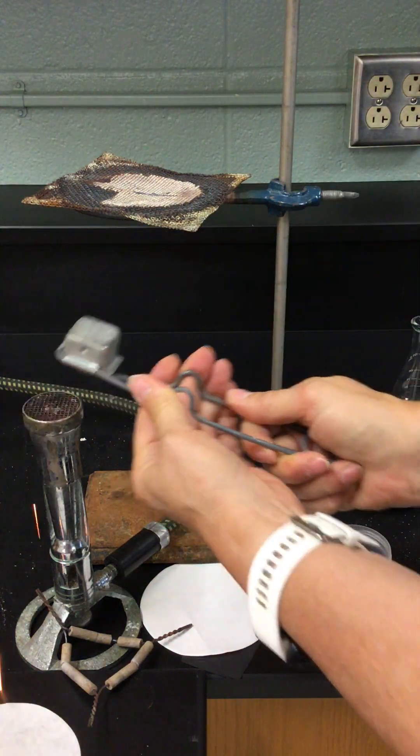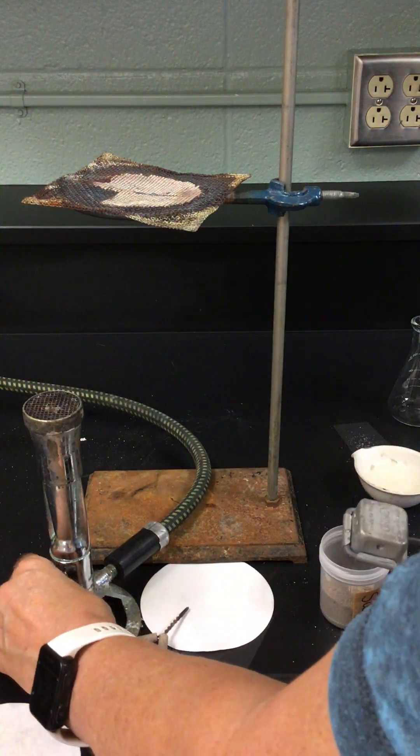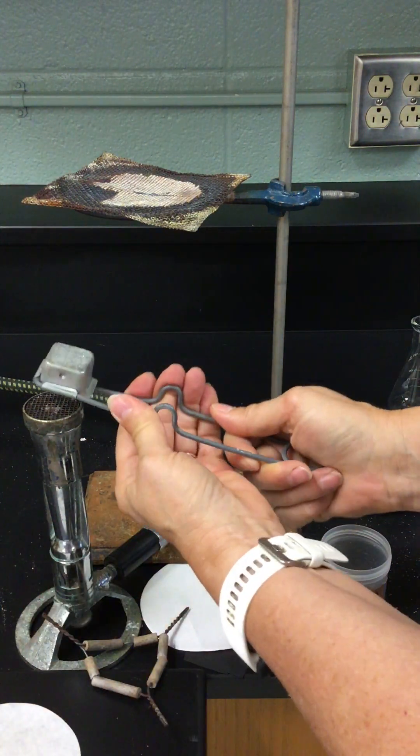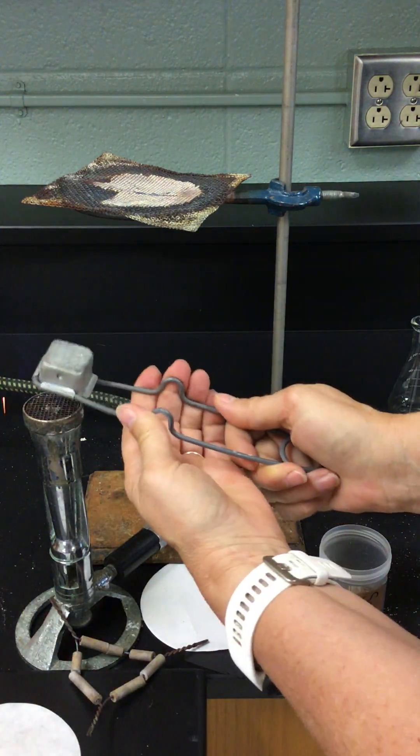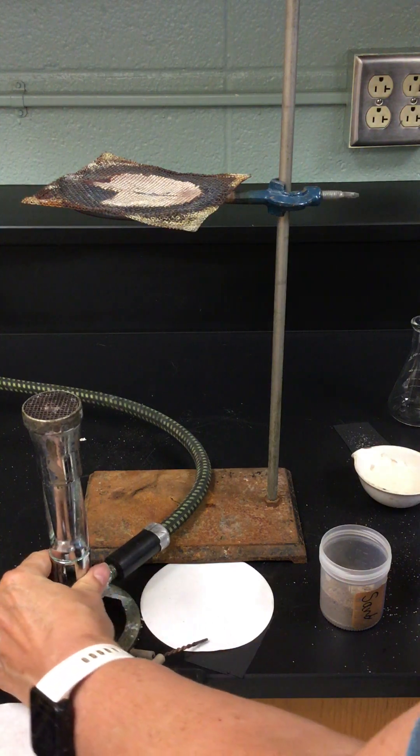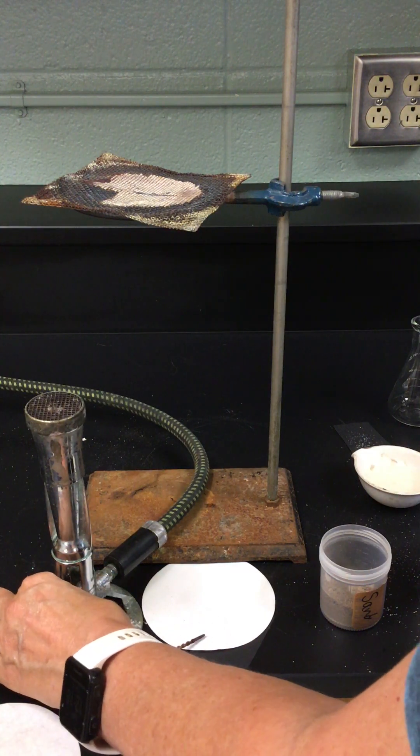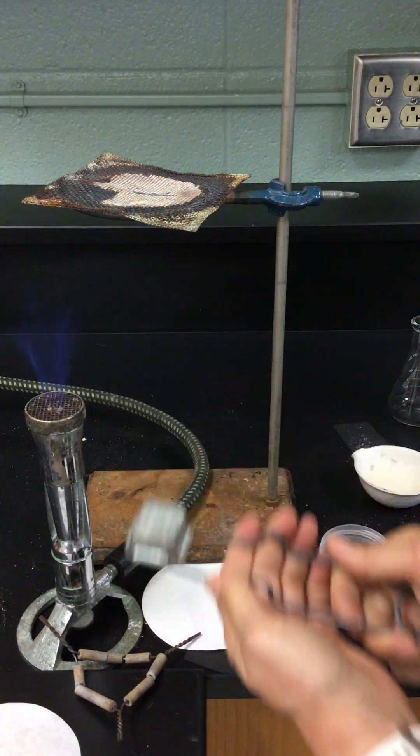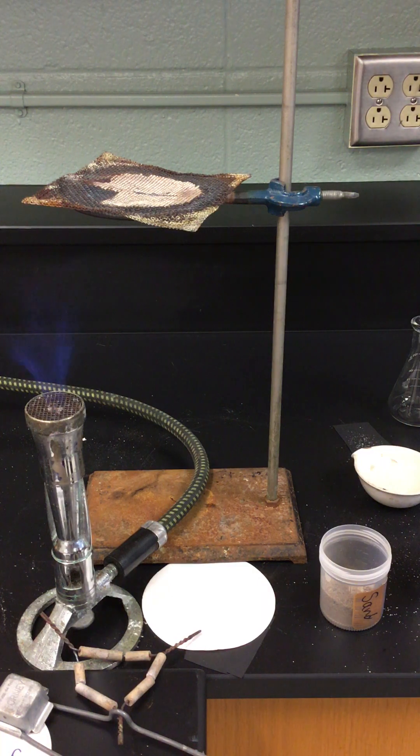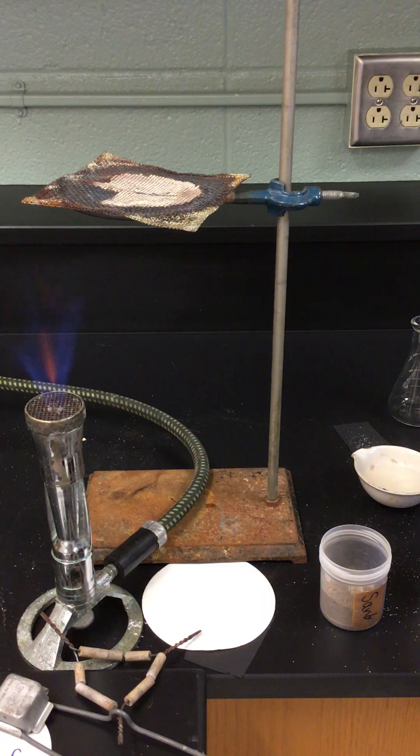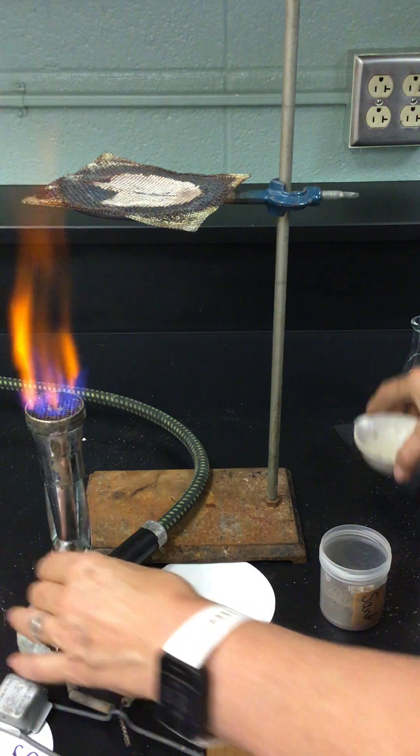Here I'm going to light it. Do I not have gas? I just turned my gas on a moment ago. It might take a moment to get the air through the lines. There, we've got a little bit going here. I don't love this flame right now. I'll have to play with it a little bit. There we've got a little bit better flame.